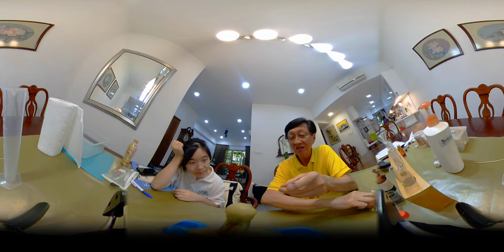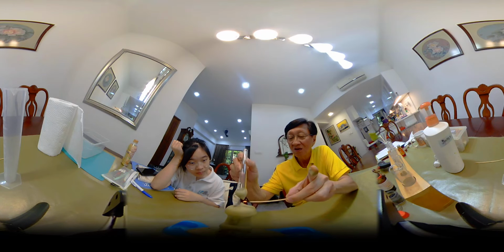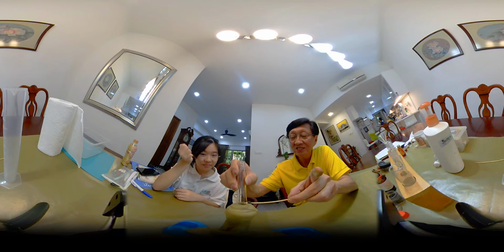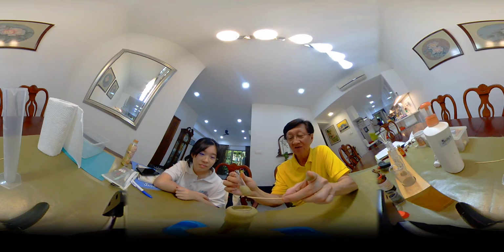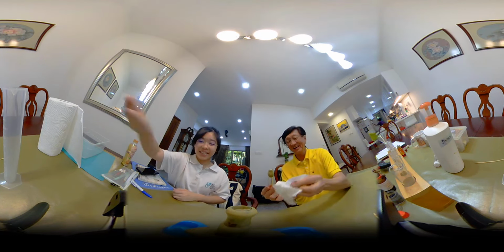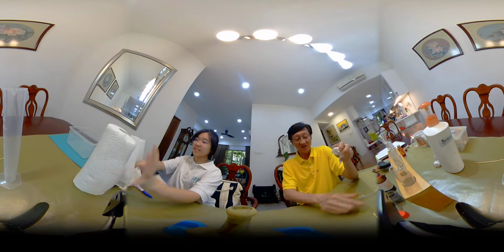Let's burst the bubble and see. Very messy. Very, very messy, but never mind. Yeah, clean it up. Good, clean it up.